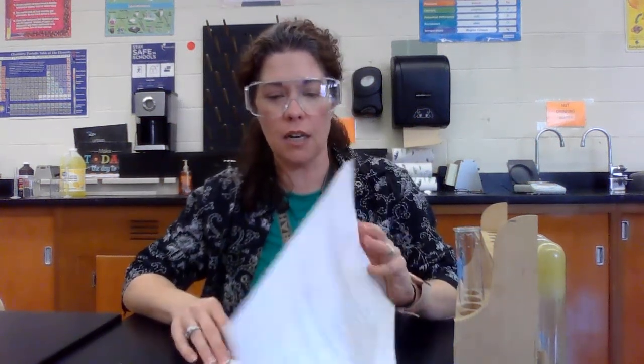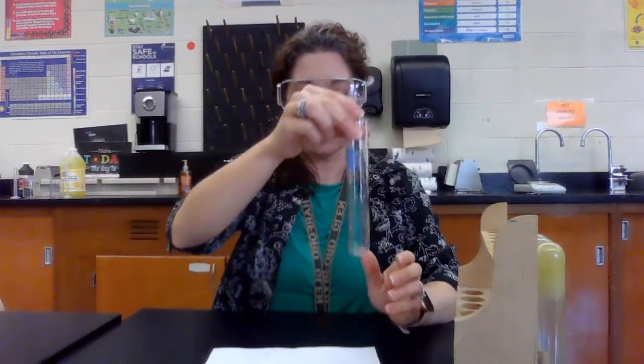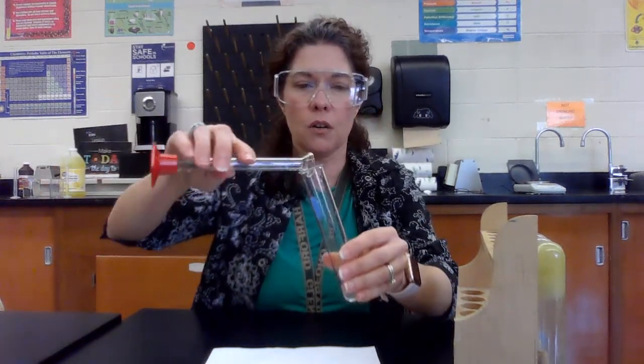All right ladies and gentlemen, this is the third reaction in Exploring Chemical Changes Laboratory. We are going to start by taking three milliliters of our universal indicator — I'm just pouring that in and it's just a very light green color.